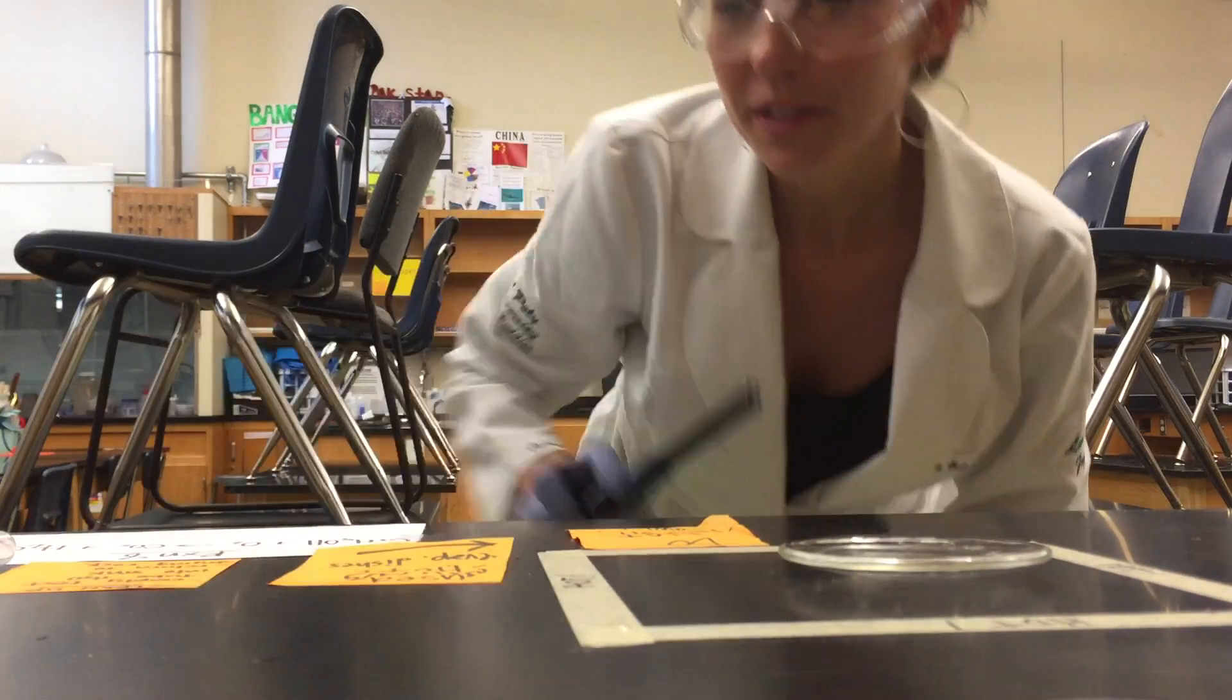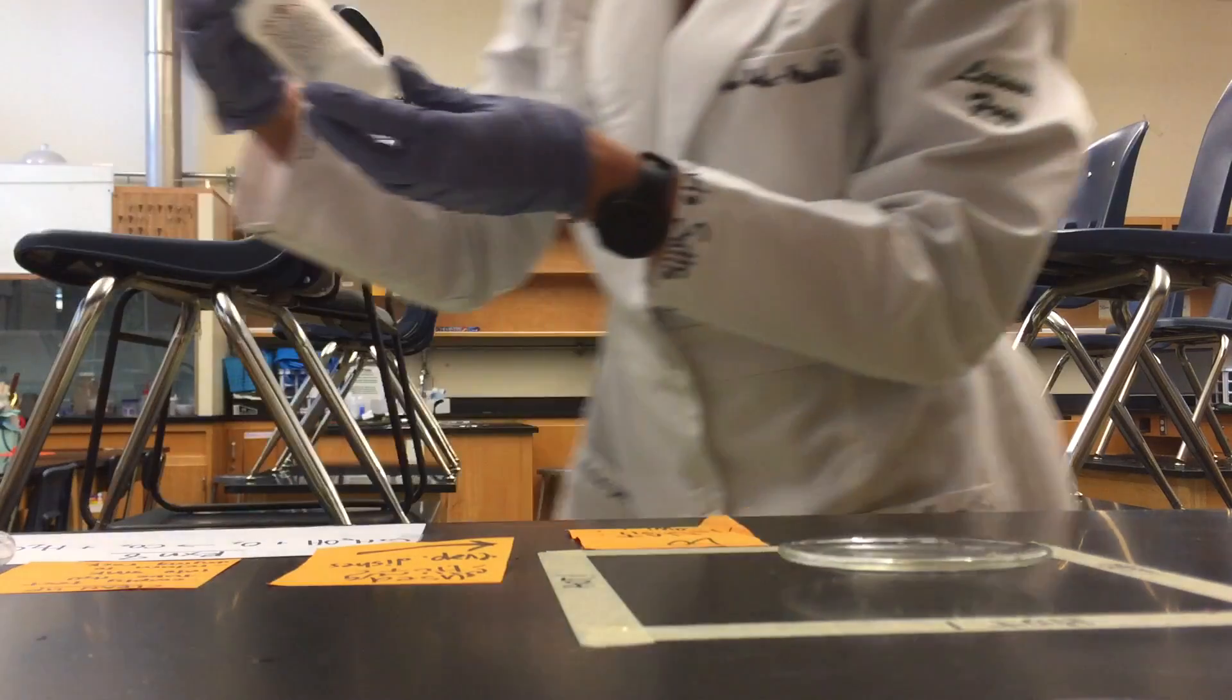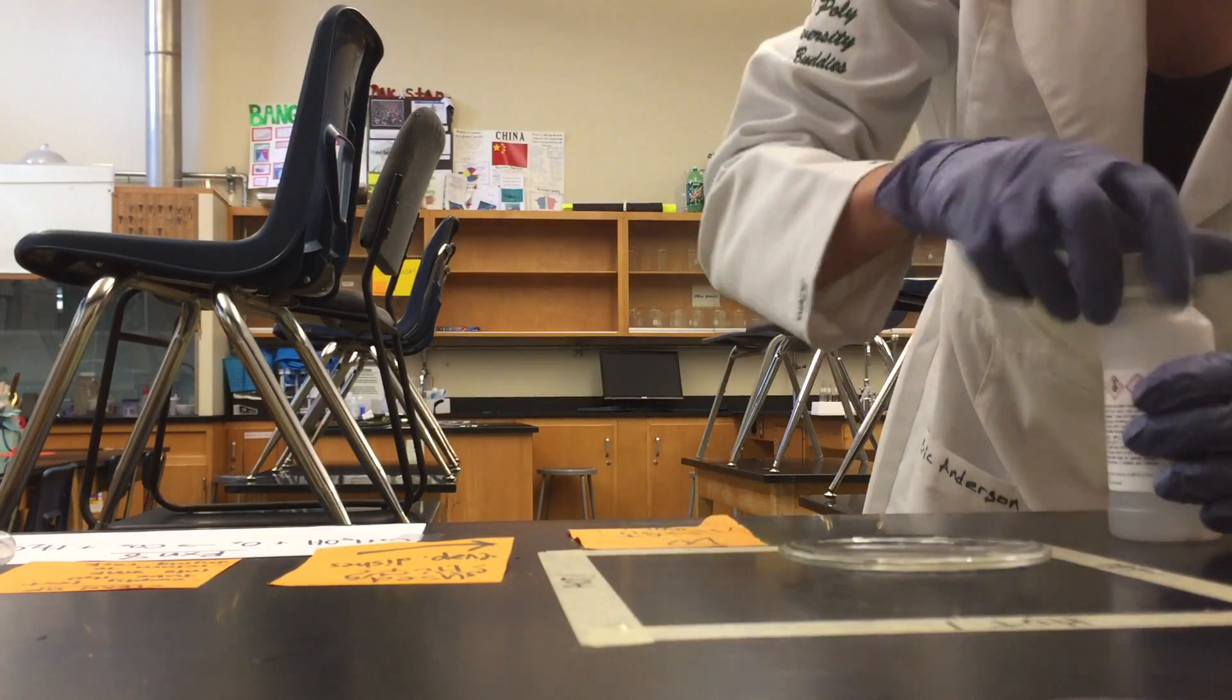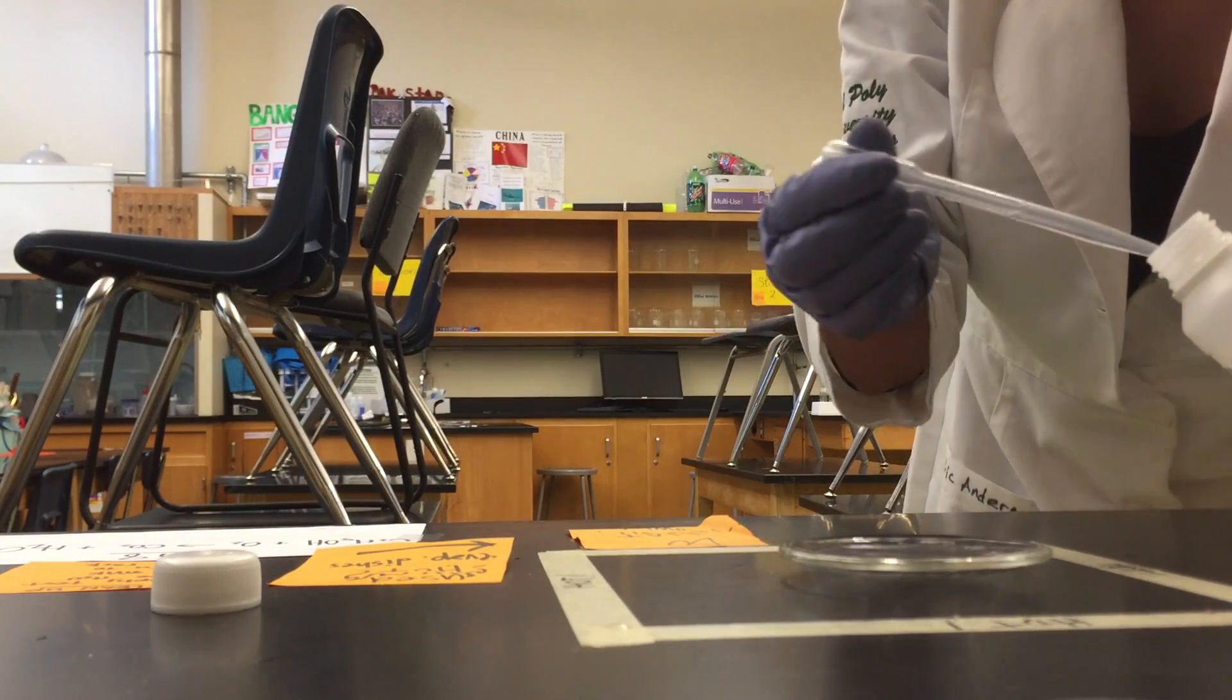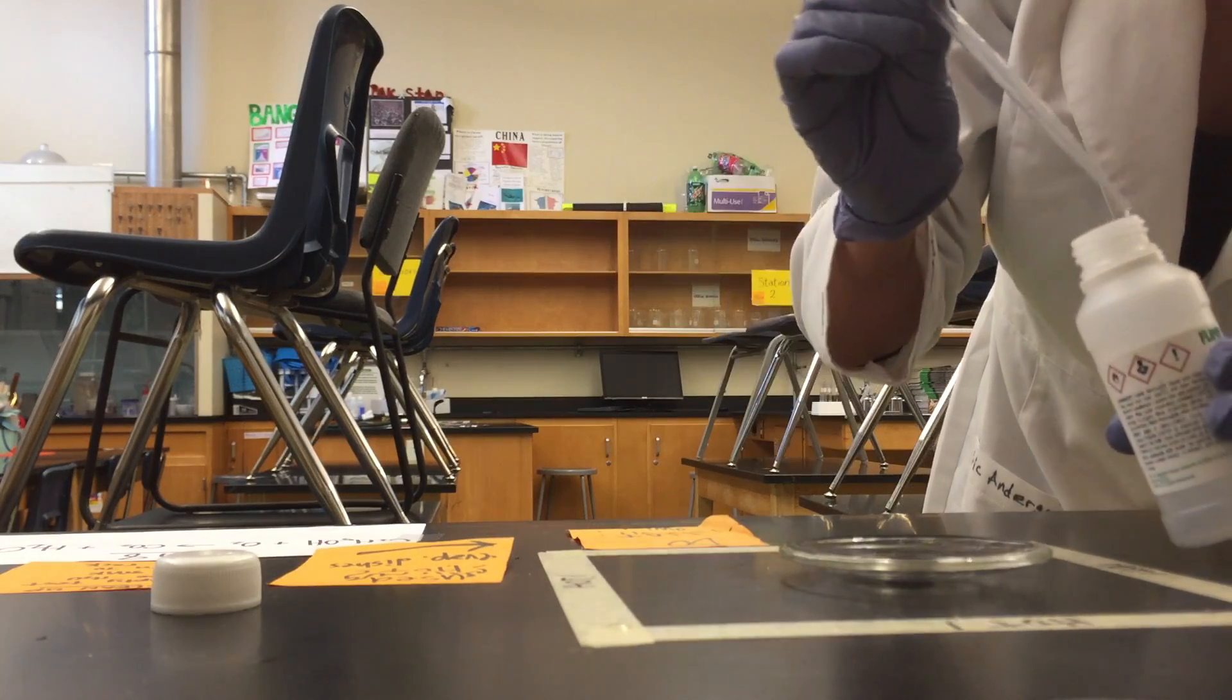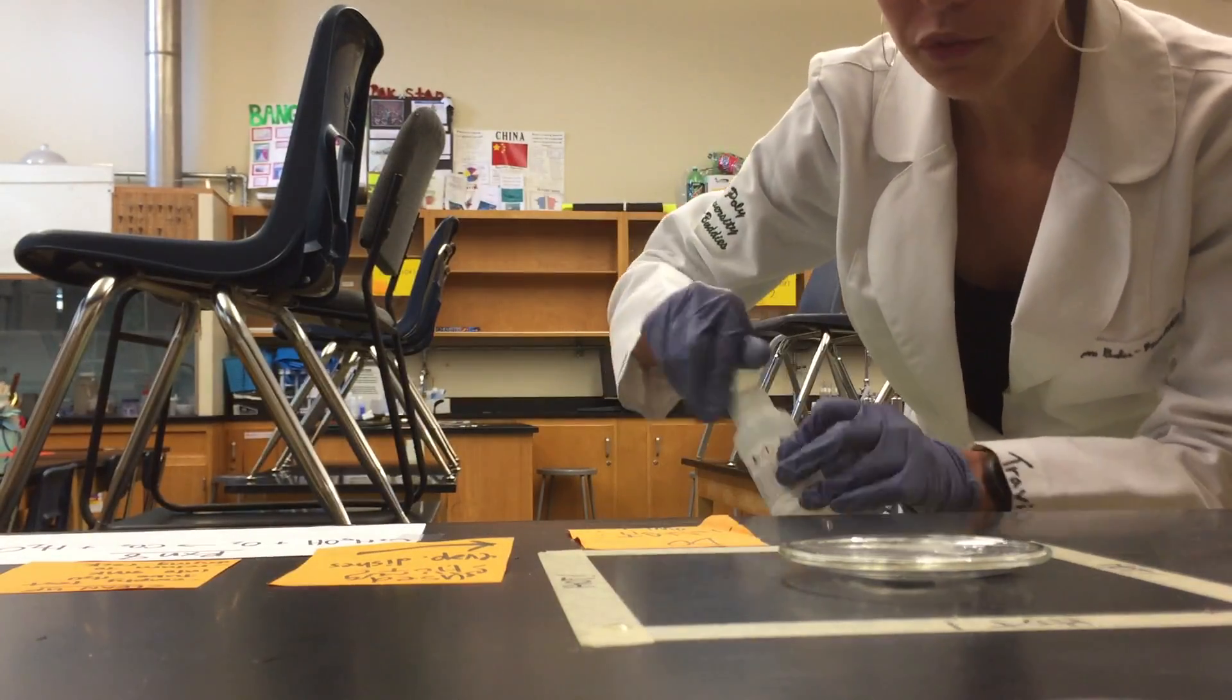Hi guys, so at this station you'll be combusting ethyl alcohol. We're going to put a couple drops of this into our evaporation dish right here, and we're going to add some oxygen in the form of fire.